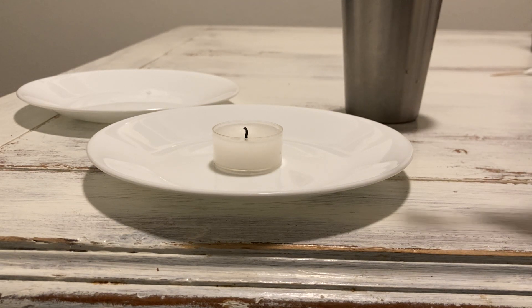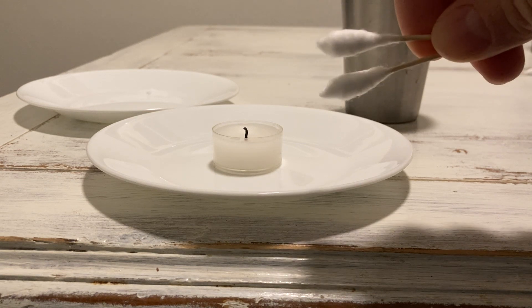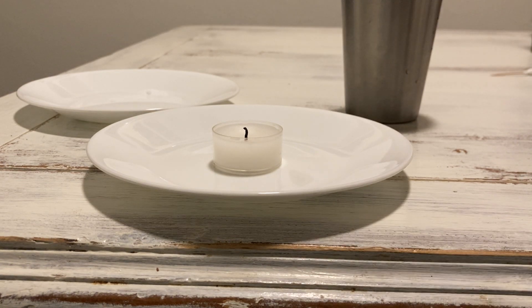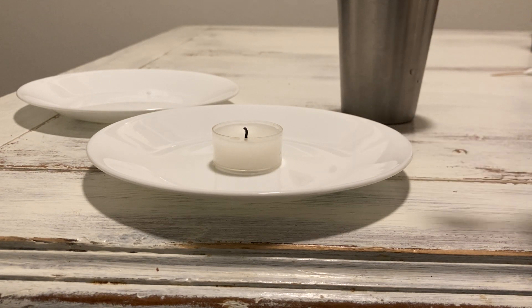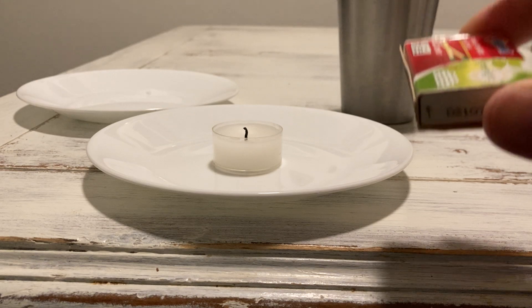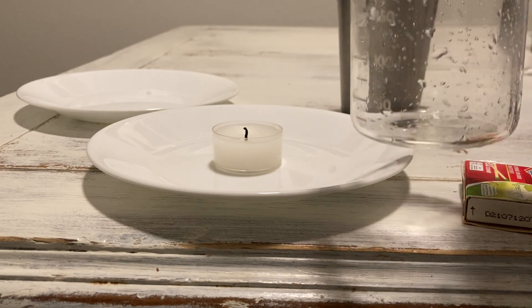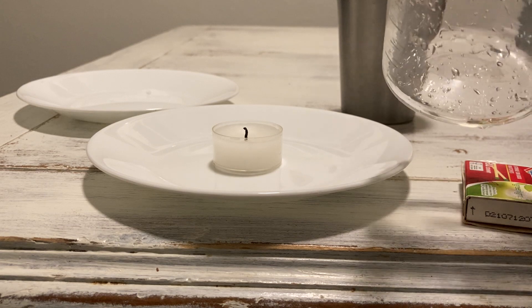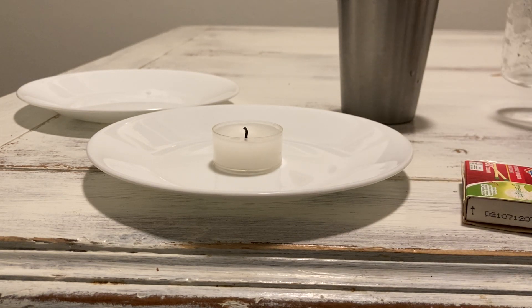I have some q-tips here — these are homemade ones on toothpicks, basically cotton swabs. I've got some water in this cup to get them wet and soak them. The last materials are some matches, a safe place to put used matches, and safety goggles just to be safe.